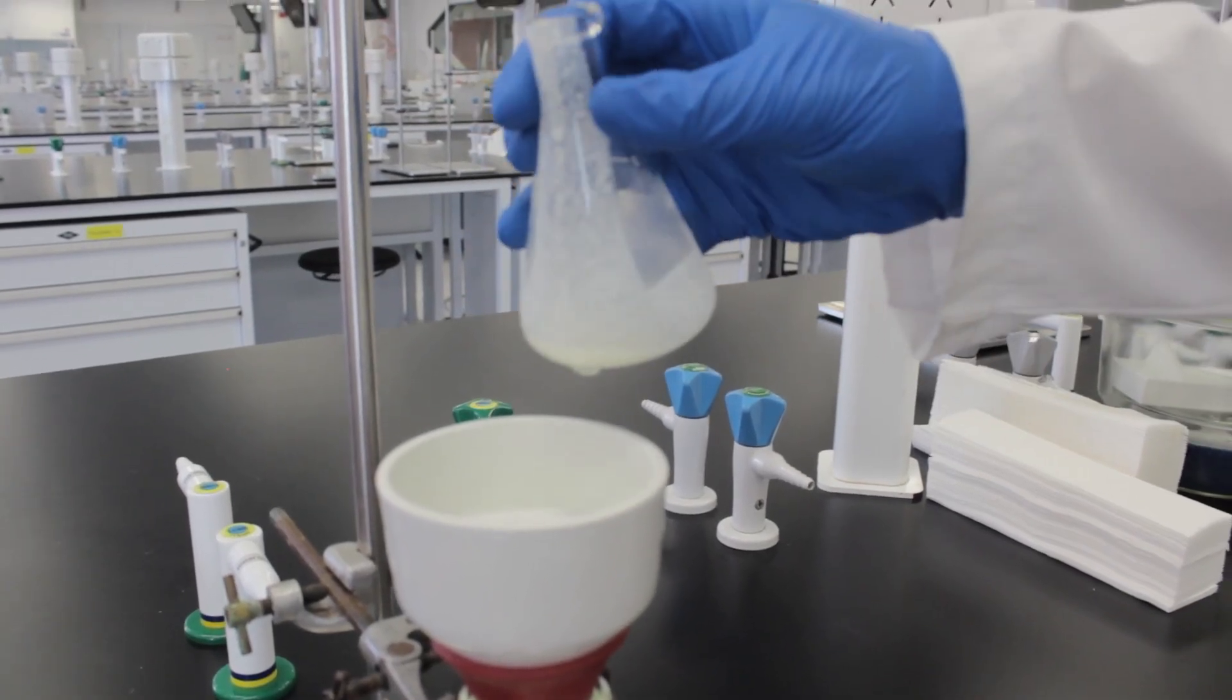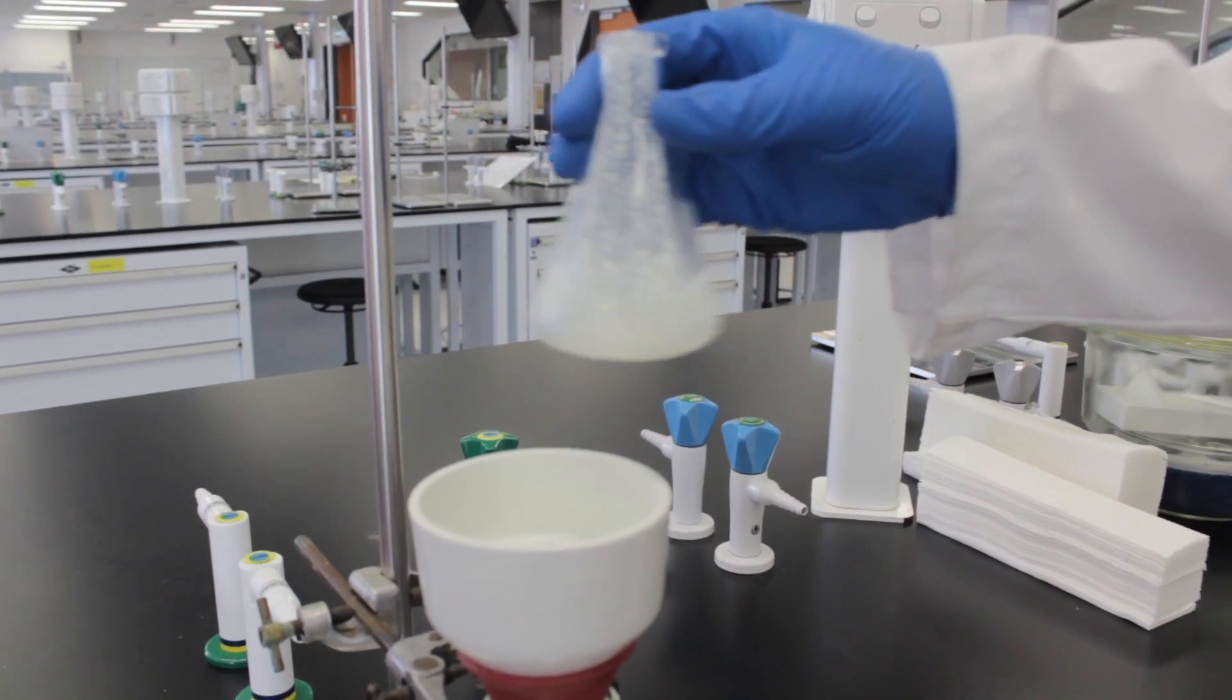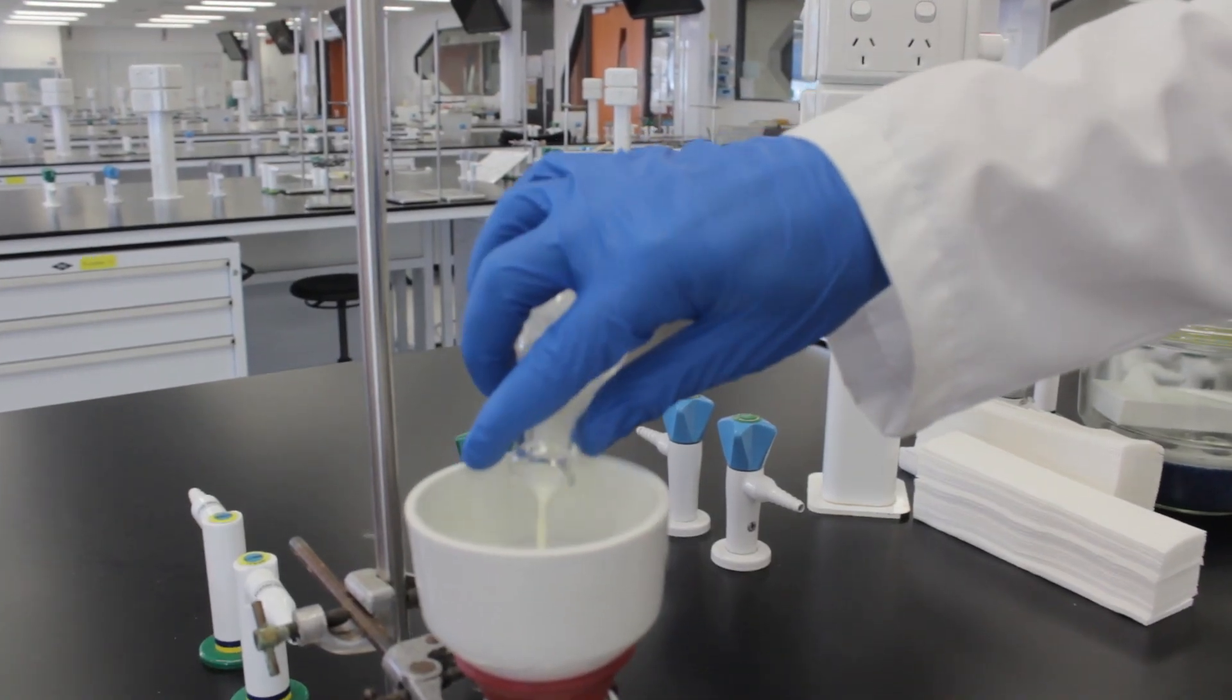Since acetone has a low boiling point, use a light vacuum to avoid evaporating all of your solvent into the vacuum system.